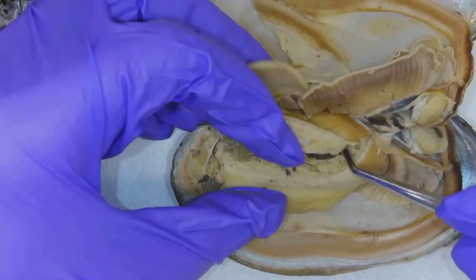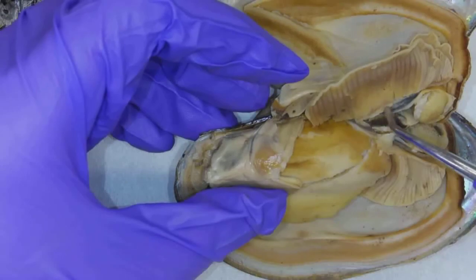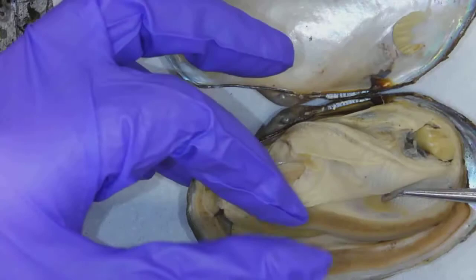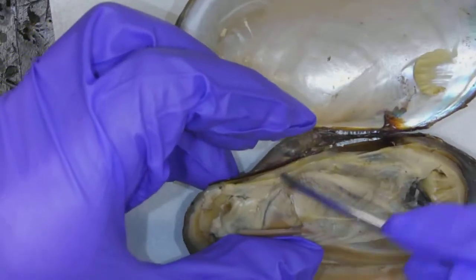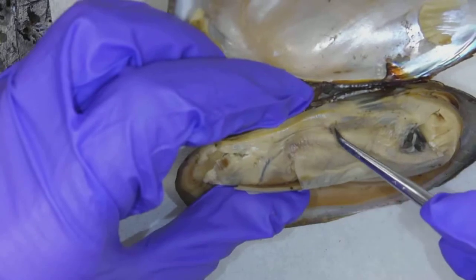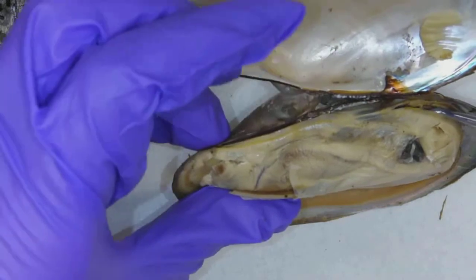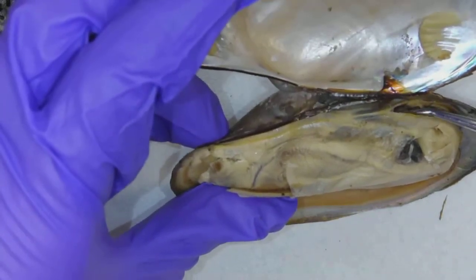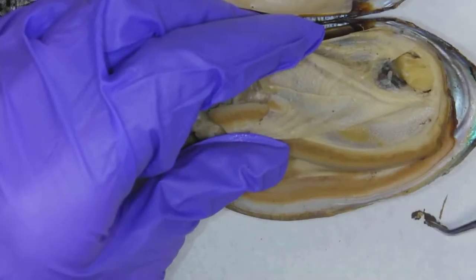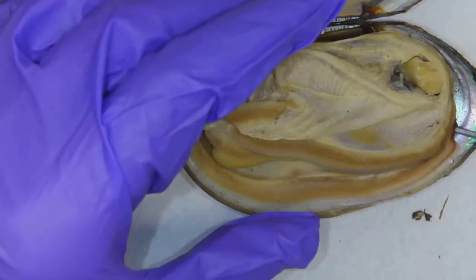The intestine is going to continue — it's going to end up going up here to the top and then up and out. The intestine runs on the dorsal side of the animal, right along here, up and out the anus, which is the opening located on this side of the animal. That's what happens when you put the probe in the anus — it's mostly sediment. Dirt.